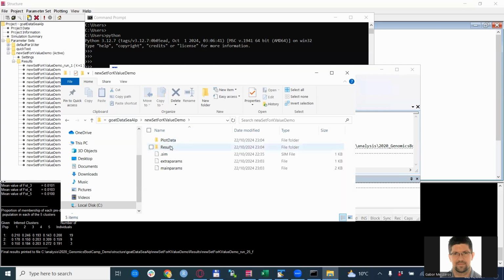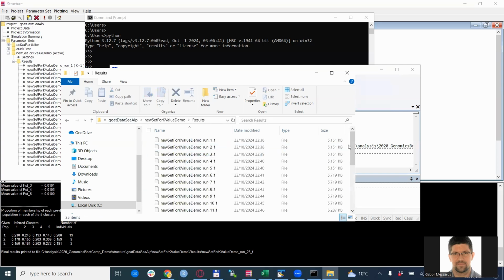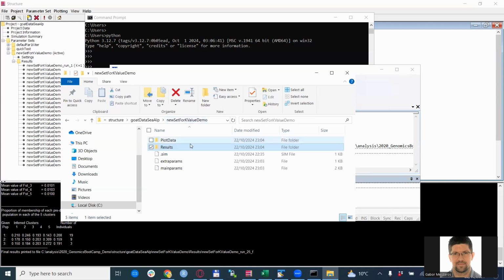You open and you see the results here. So there's a results folder. You open just to be sure. So there are all the runs here. So 25 runs because, well, we did 5 k-values, 5 iterations each. So this is the kind of the partial results.